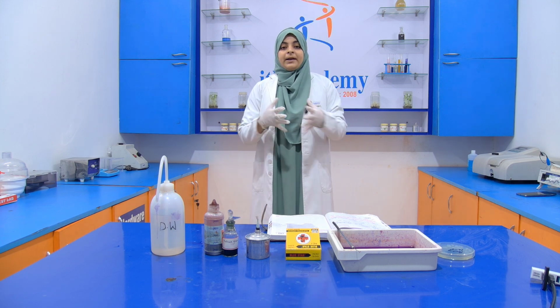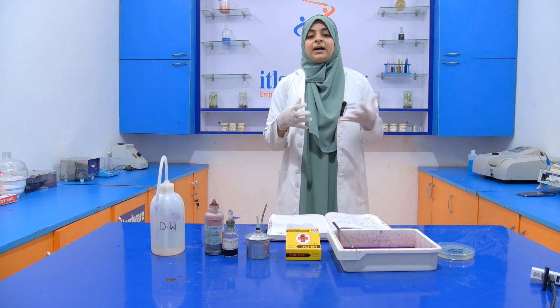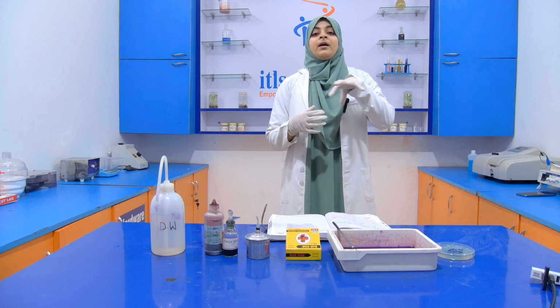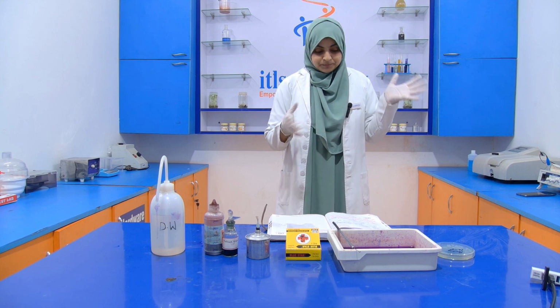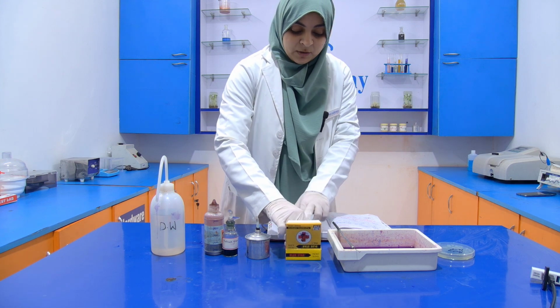That I already told you. Malachite green is water soluble, and when we use distilled water for rinsing, if endospores are not present, then the stain will be washed out by the distilled water. Okay, now let's start the experiment. First of all, take out the slide.